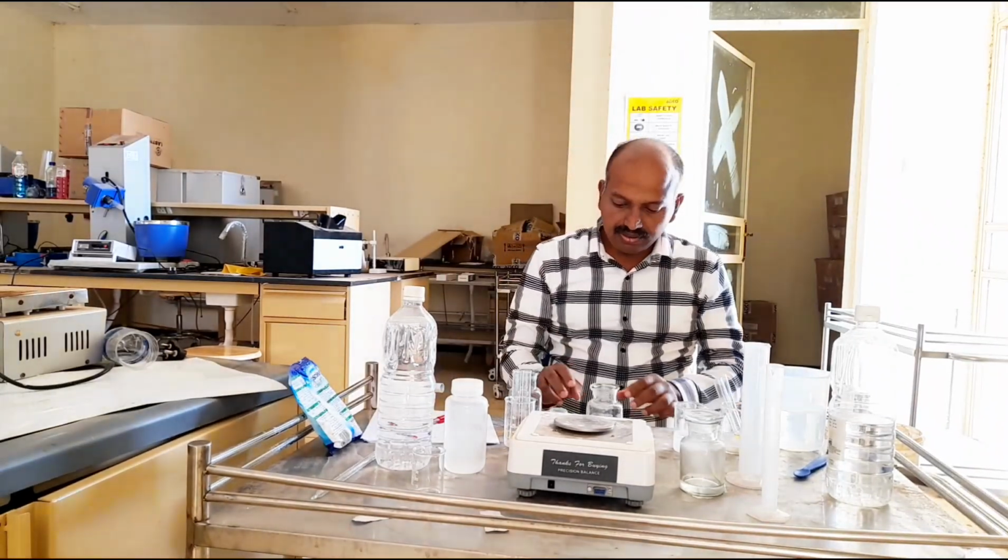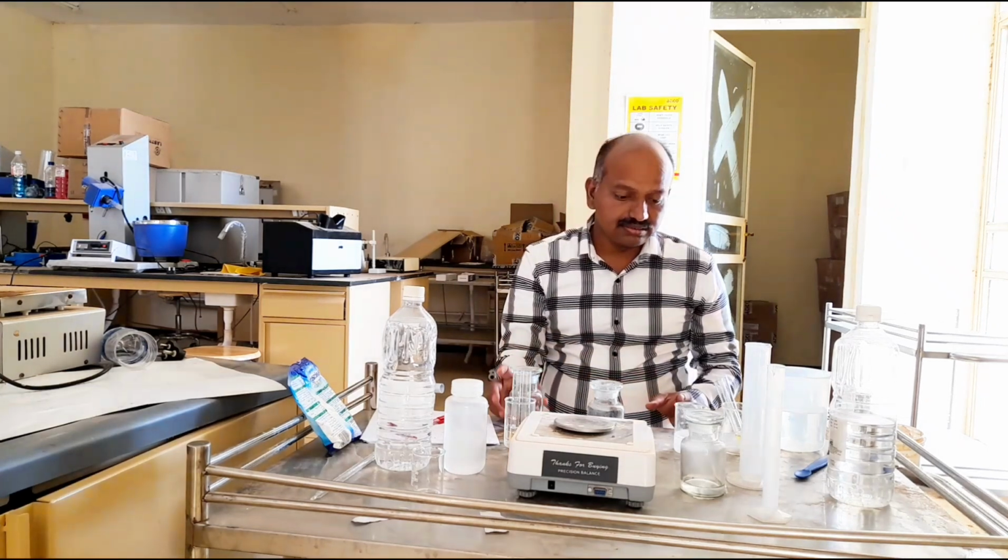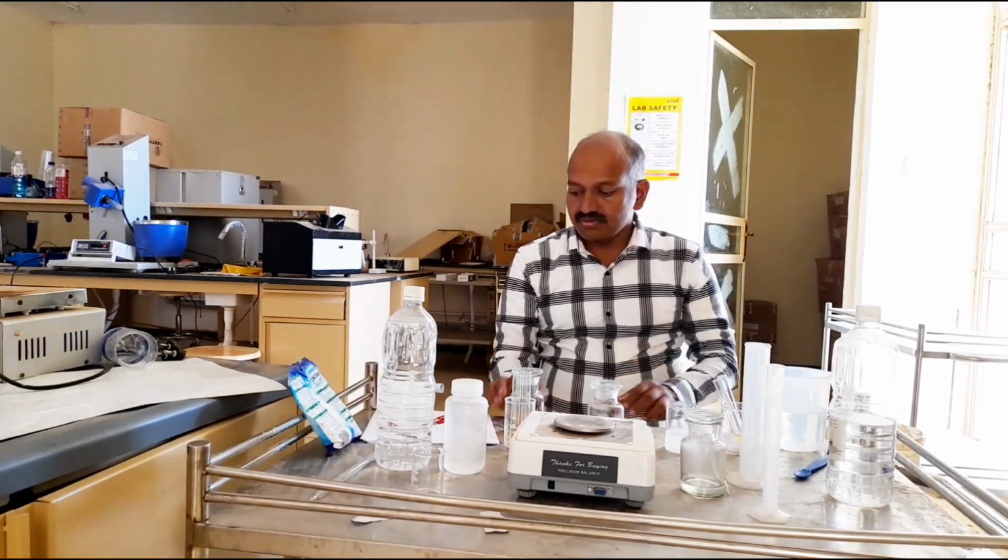This is about the precipitation tests of potassium soap and detergent.